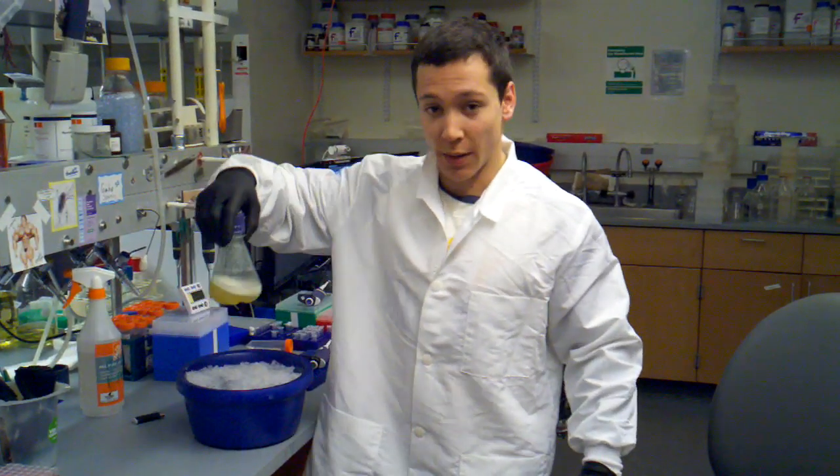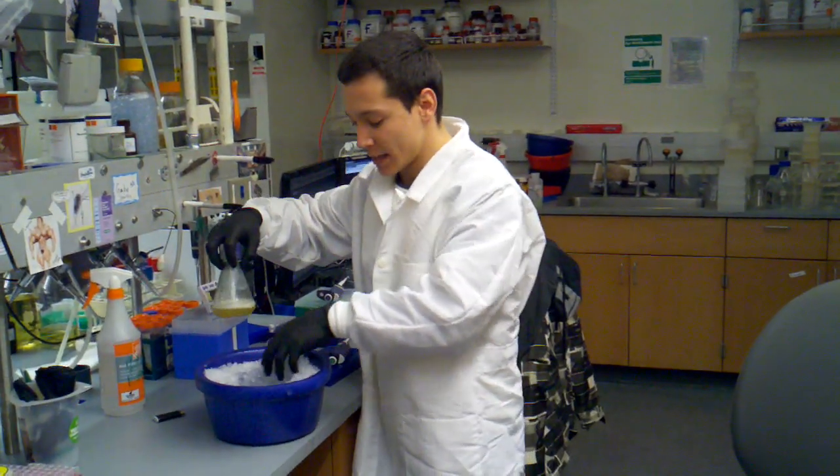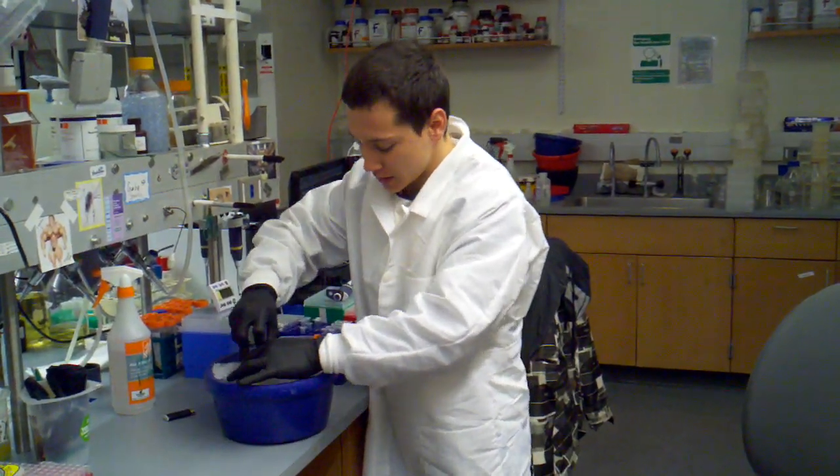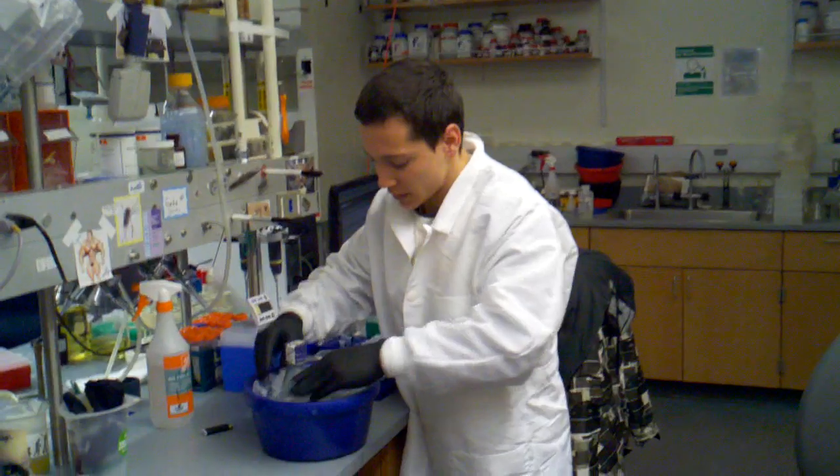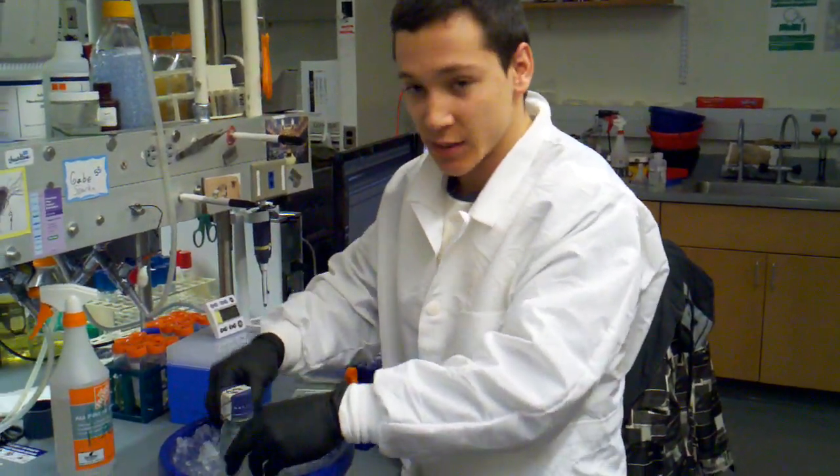I just ran to the 30 degree room and picked up our induced culture and we're going to put it on ice. Now I added water to this ice bath. I'm just going to squish it down, cover it in ice.